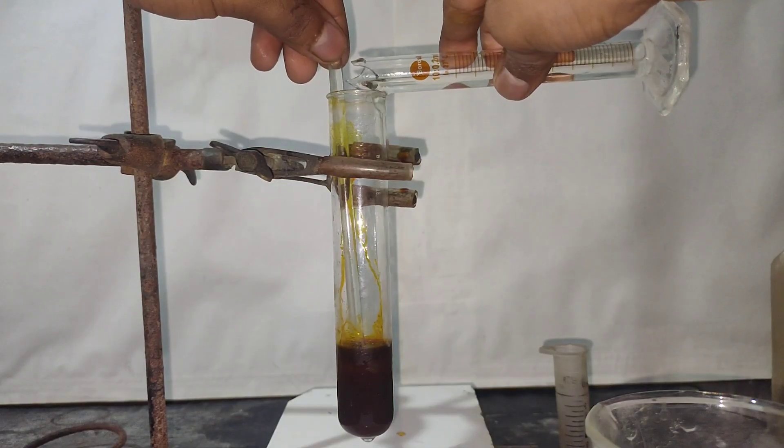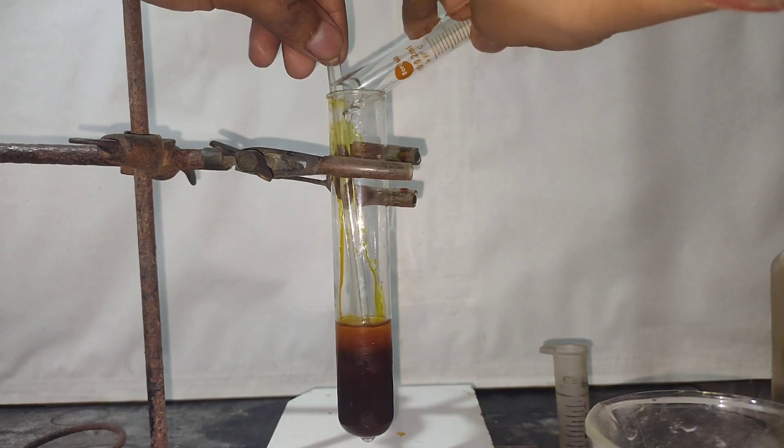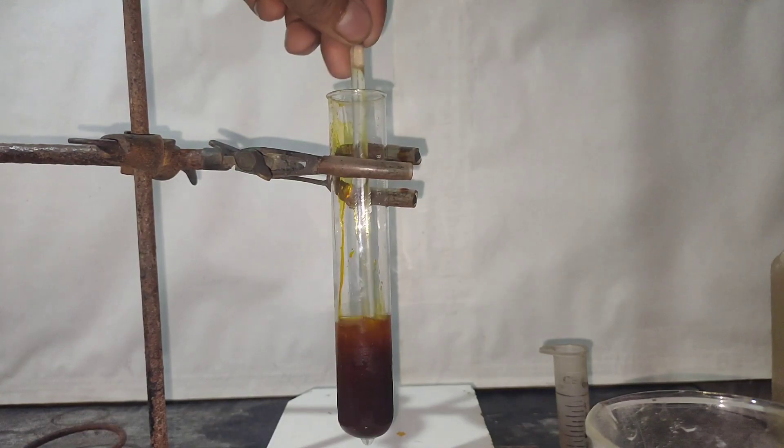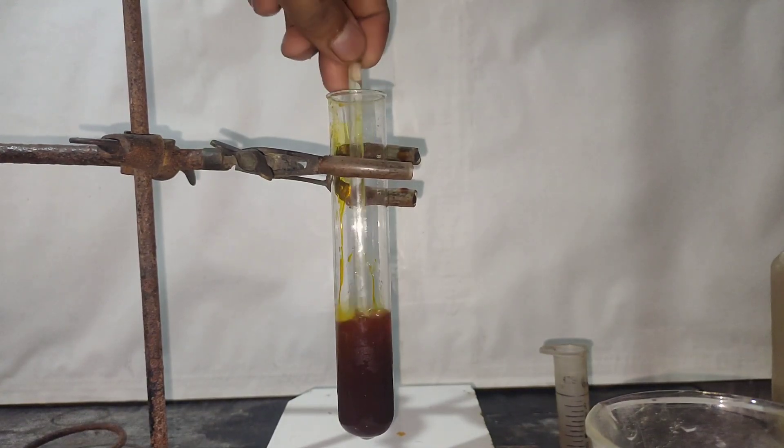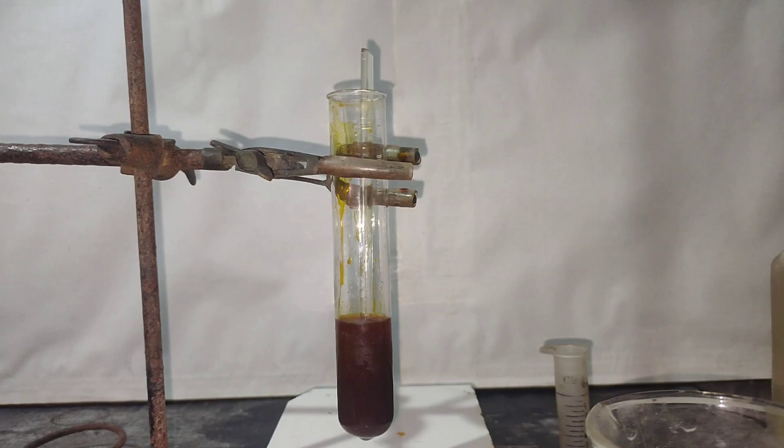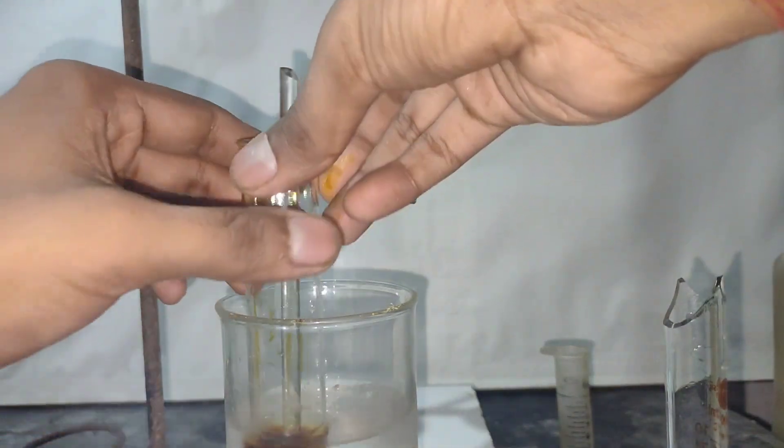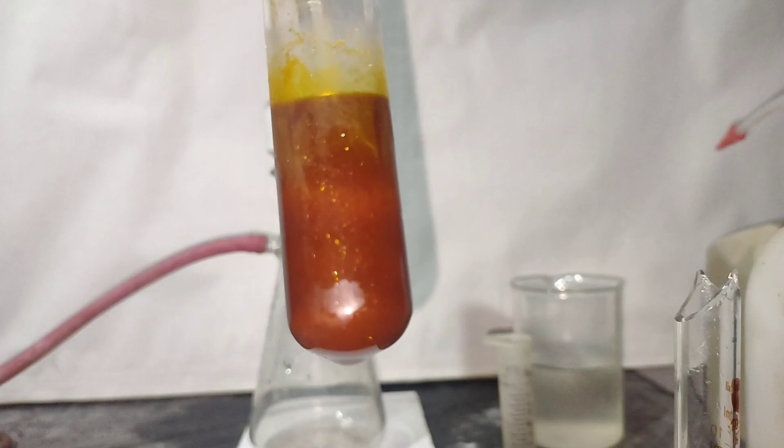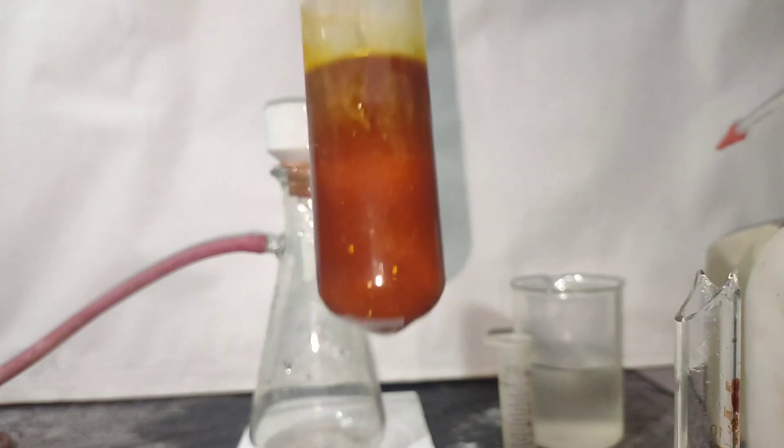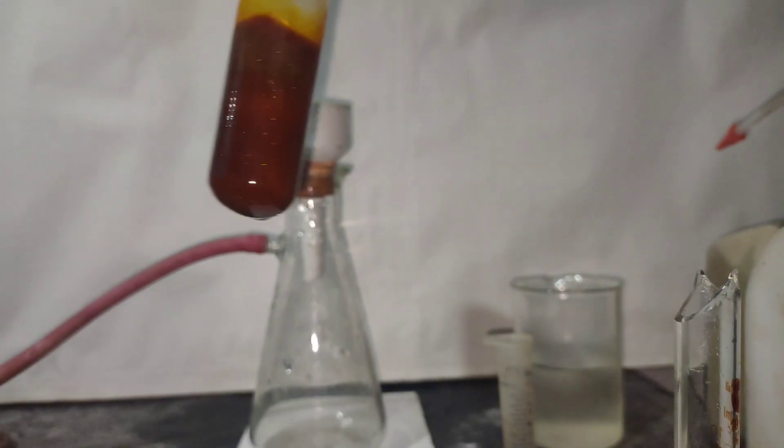To this cooled solution, I'm adding a total of 10 ml of cold ethanol. Then I again kept the test tube inside the ice bath. After cooling, you can see that more crystals formed.